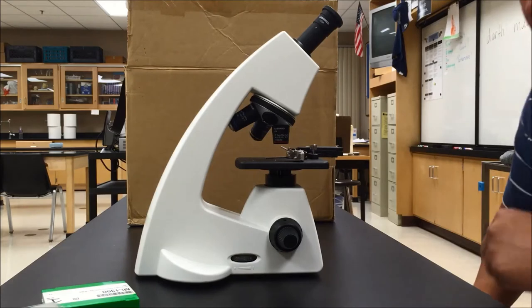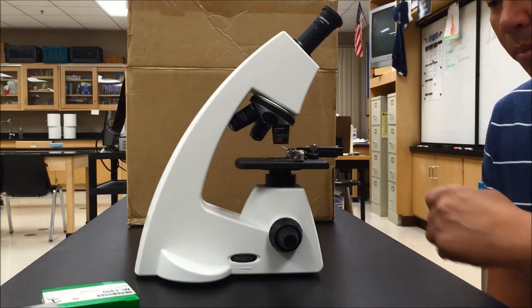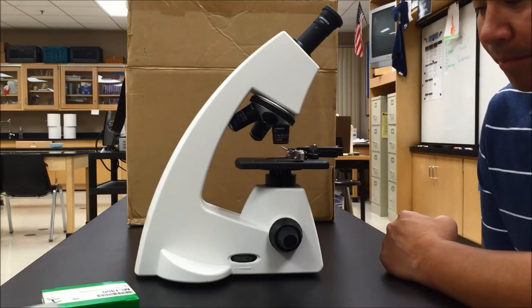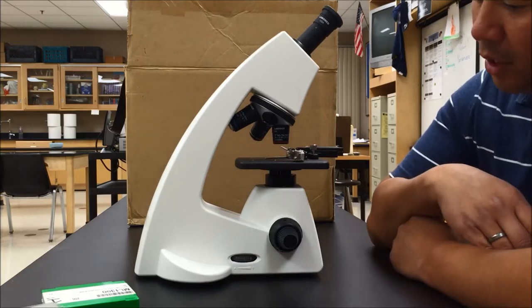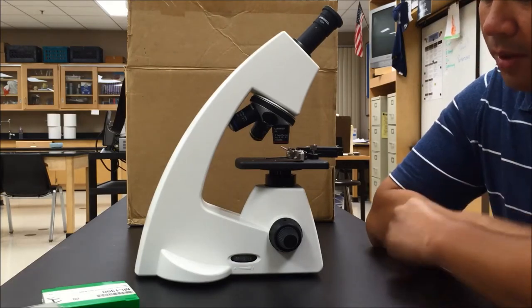In this video we're going to go over the parts of a microscope in preparation for the tissue identification lab. In this class you'll be using a cordless microscope.